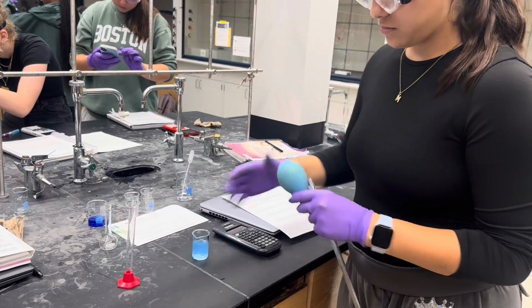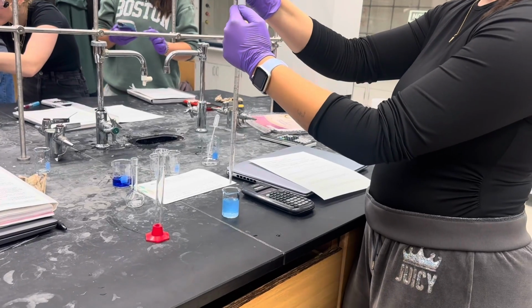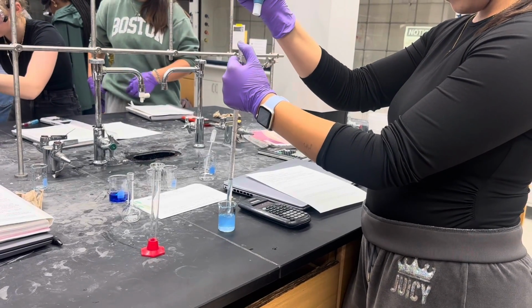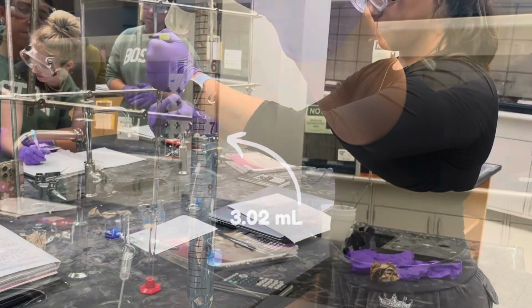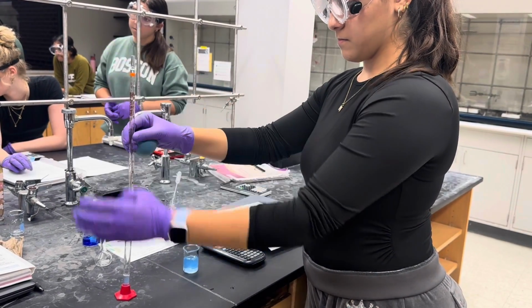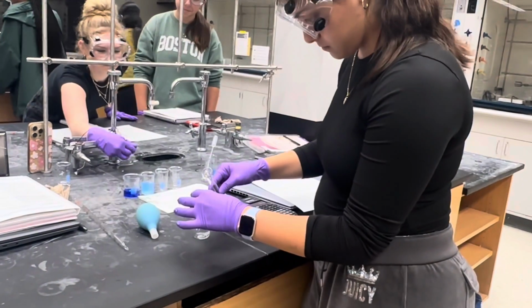For the second dilution, pipette 3 milliliters of your first diluted solution. When measuring, make sure to read the meniscus properly. The meniscus is the curved surface of a liquid caused by the liquid's attraction to the container walls. Always align your eye level with the container and read the lowest point of the curve for an accurate measurement. After confirming your reading, verify the volume in a graduated cylinder, and transfer the solution into a clean volumetric flask.